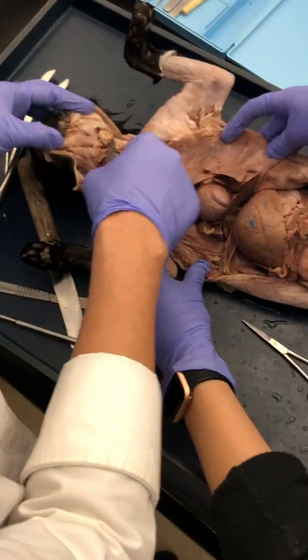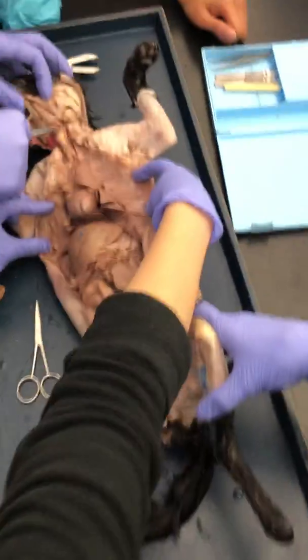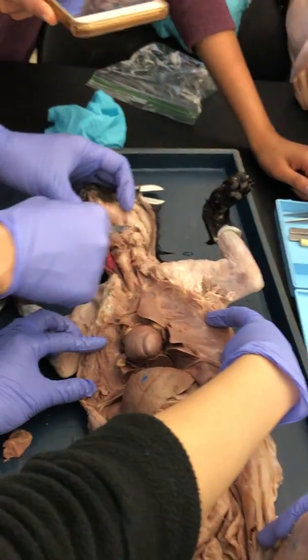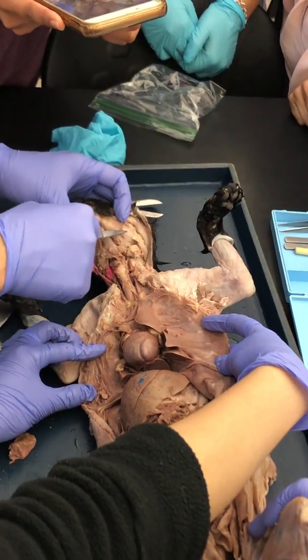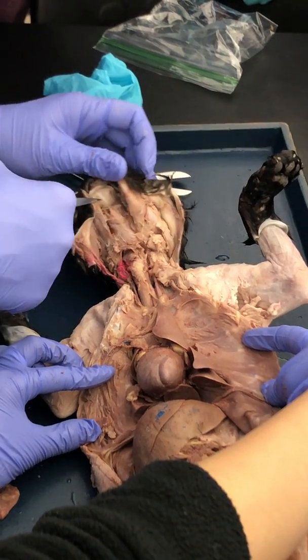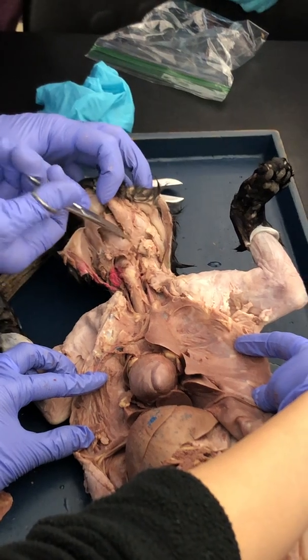And then right up here, if you still have that blood vessel coming up over here, kind of looks like this. It looks like the lymph node, but the lymph node would lie right about here. Okay, you don't have it in this cat. We need to open this cat up.